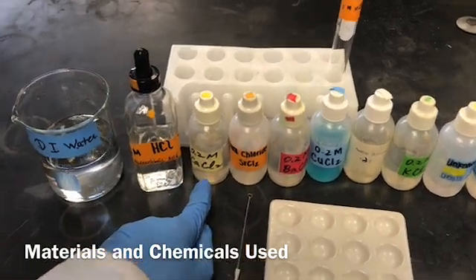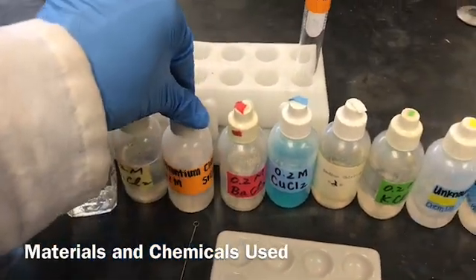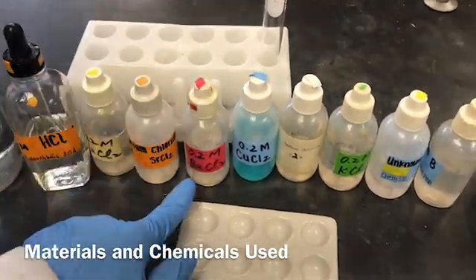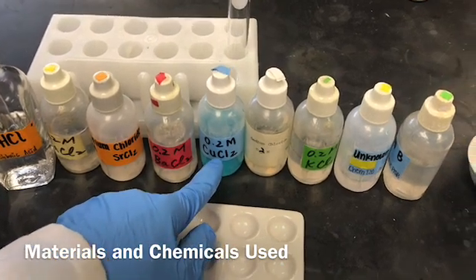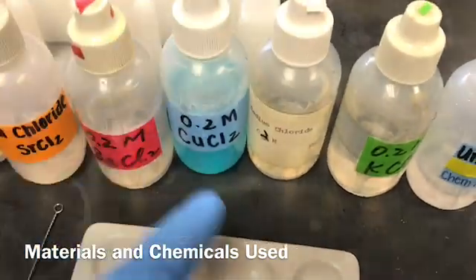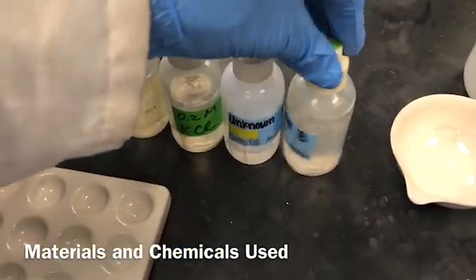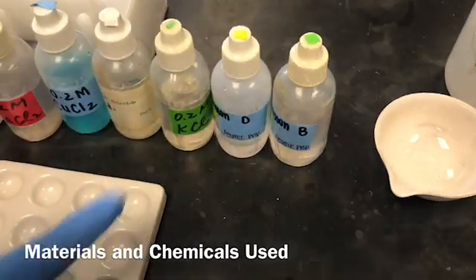We need 0.2 molar calcium chloride as the source of calcium ions, 0.2 molar strontium chloride for strontium ions, barium chloride for barium ions, copper(II) chloride for copper ions, sodium chloride for sodium ions, and potassium chloride for potassium ions.